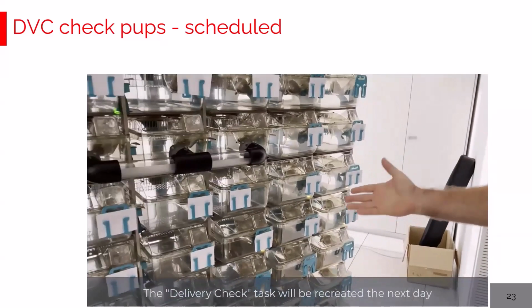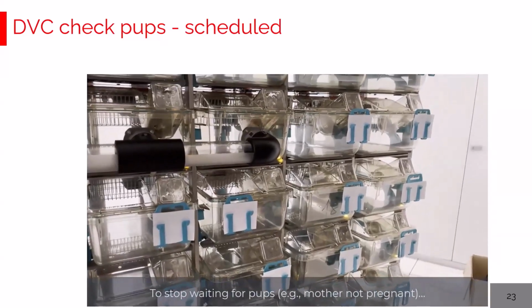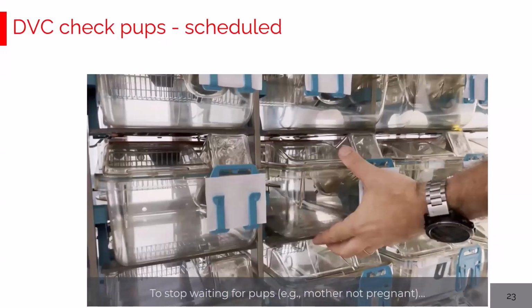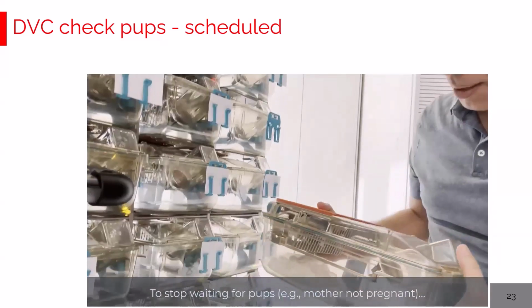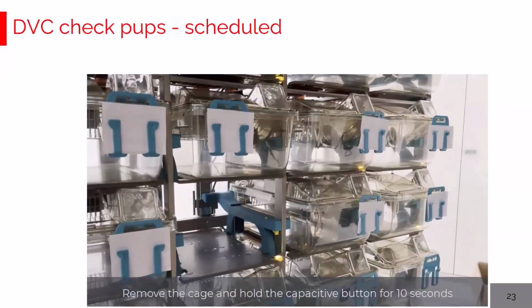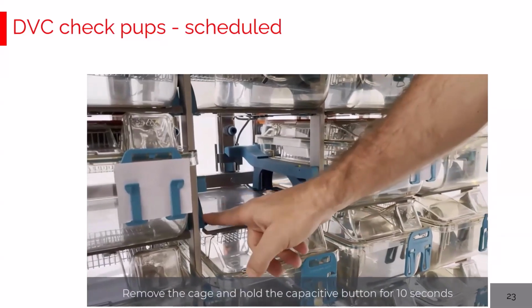The last potential use case is about the possibility to stop creating delivery check pups tasks. In this case, I want to look for the pups, and I discovered that even the mother is not pregnant, and I don't want tomorrow to create the task. I really want to stop creating tasks for this breeding cage.